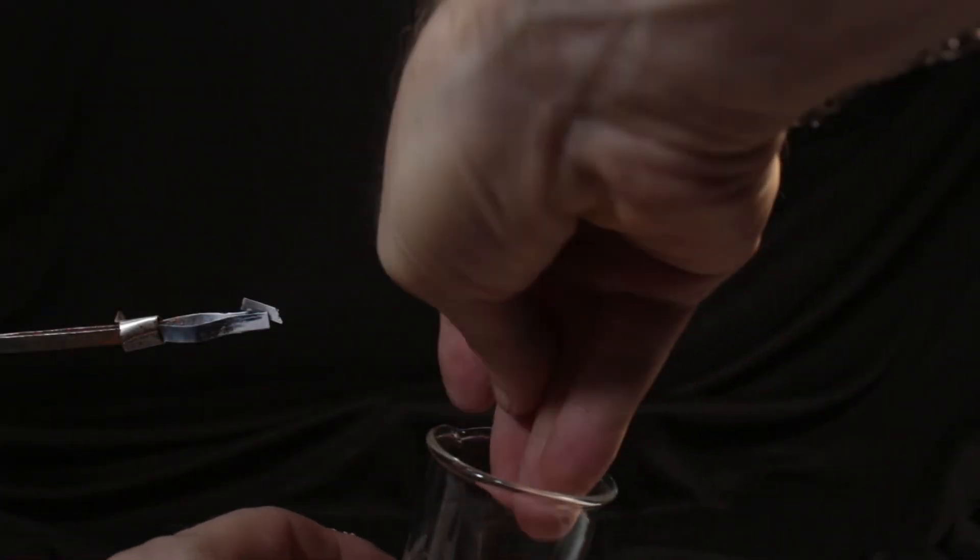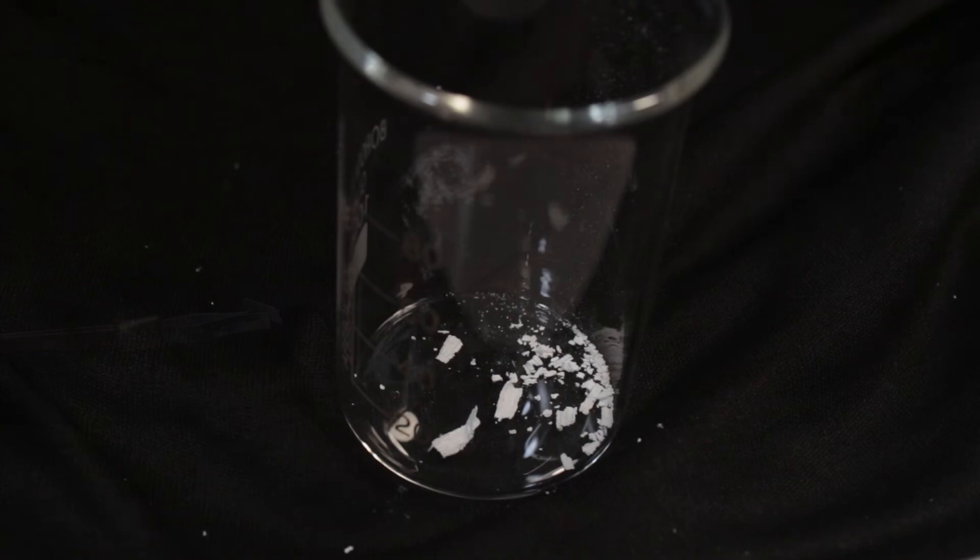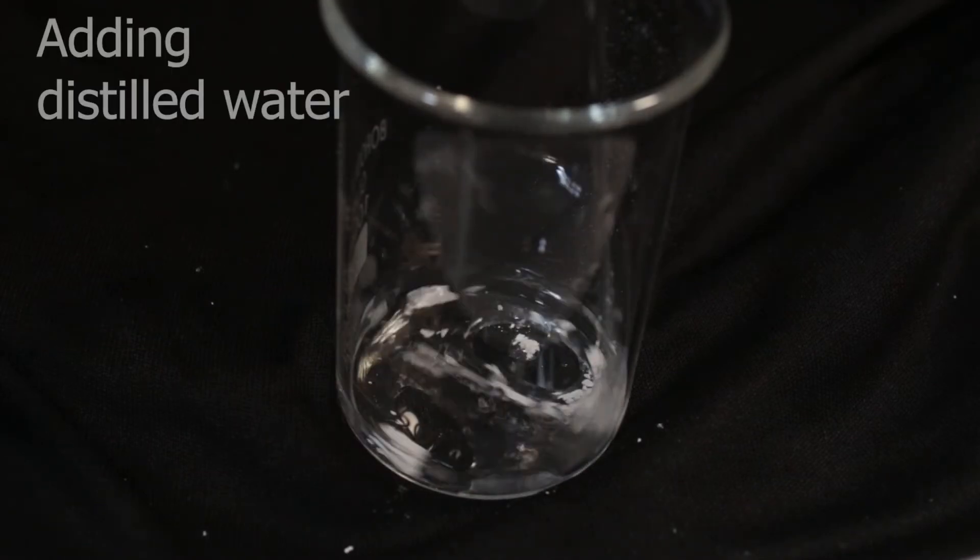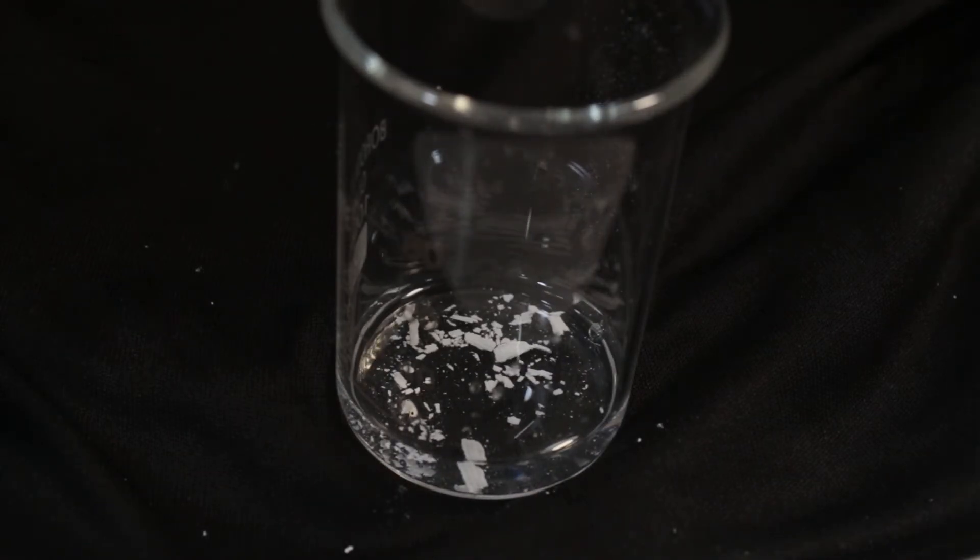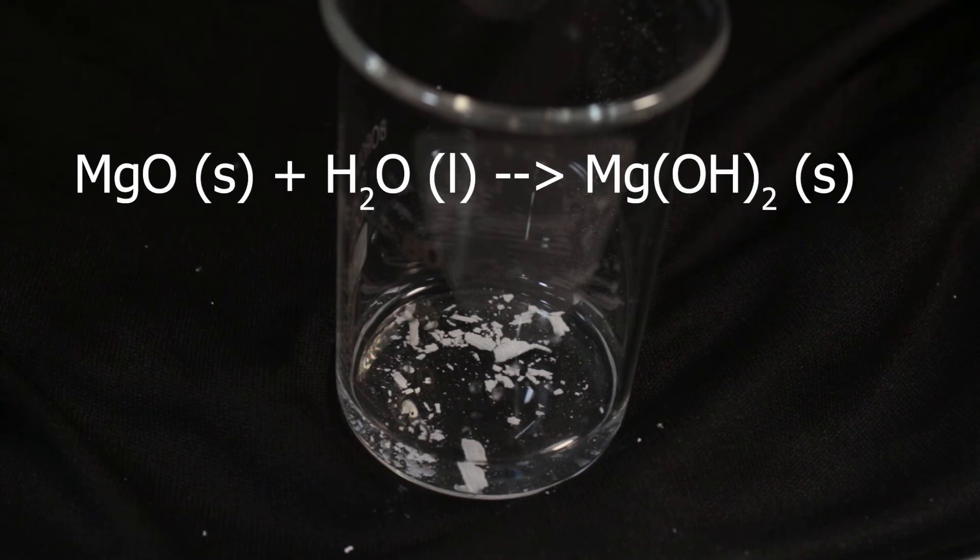Let's try to dissolve it in water and check the pH. If we add water, no visible change is taking place, but we expect one change to happen: formation of magnesium hydroxide.